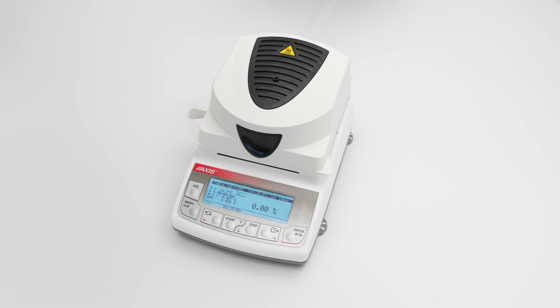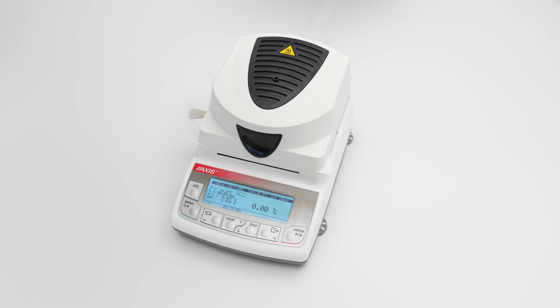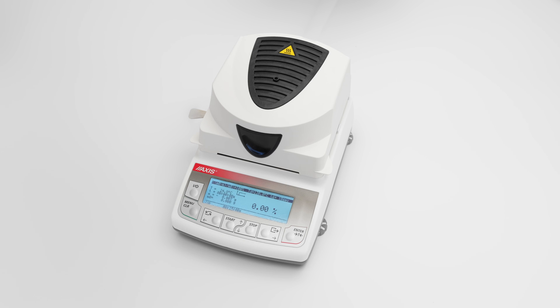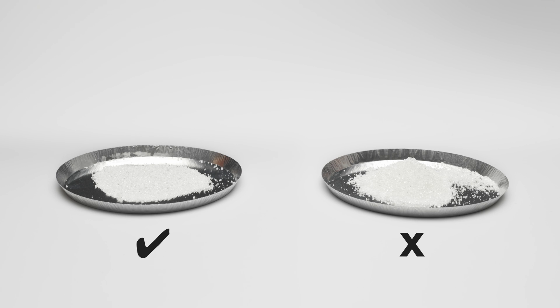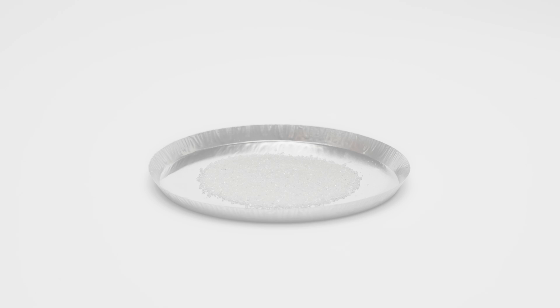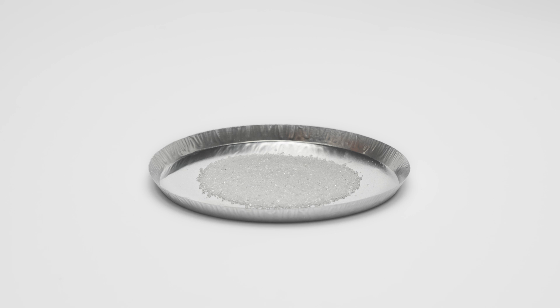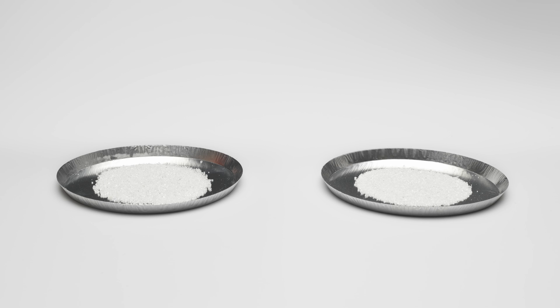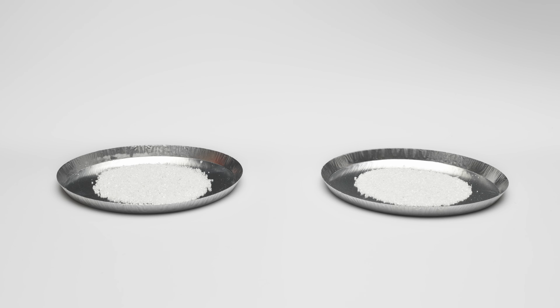Proper sample preparation is necessary to obtain accurate and repeatable measurements. There are a few things to keep in mind: 1. Distribute the sample evenly on the surface of the pan. 2. The thinner the sample material layer, the better the drying process. 3. If you make several measurements for the same type of material, each subsequent sample should have a similar mass.